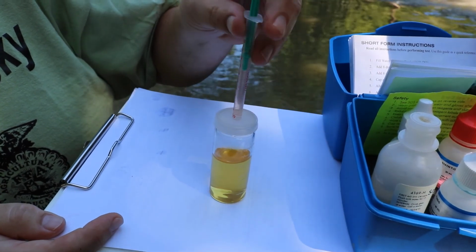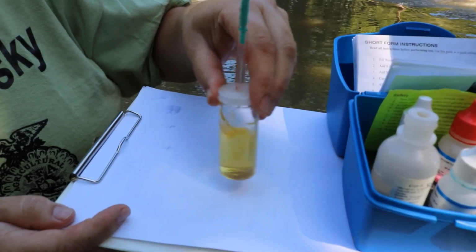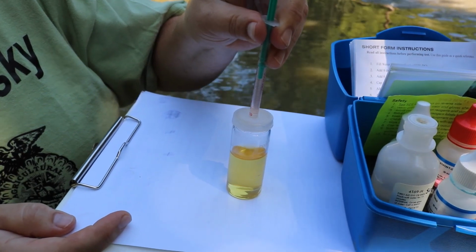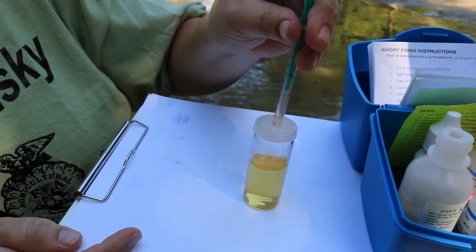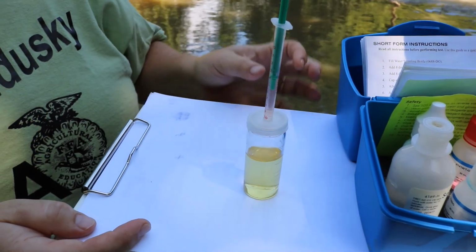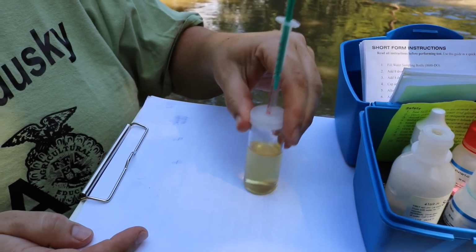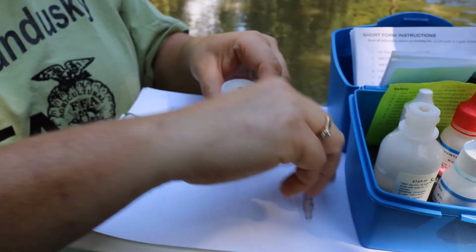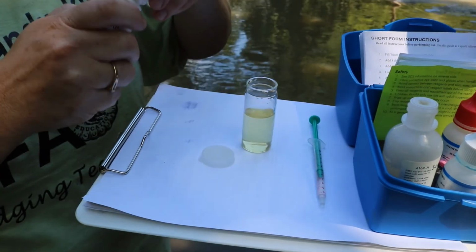So you just have to gauge it to make sure, okay, is one more drop going to make it go clear? I don't want to get to that point. Still fairly yellow. And one or two more drops. So now I have a pale yellow. I think we can do one more. Now we're going to put a starch indicator in, which is going to turn it blue. And we're going to titrate this to clear.